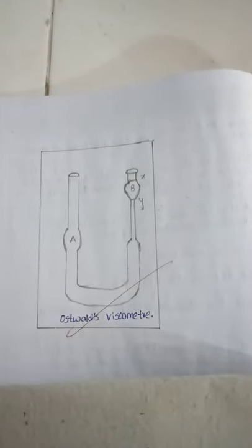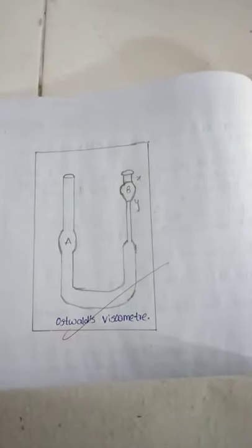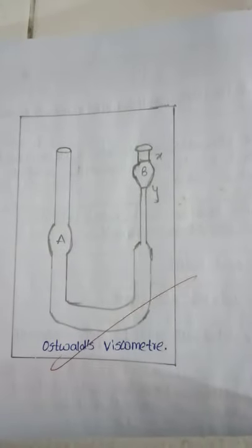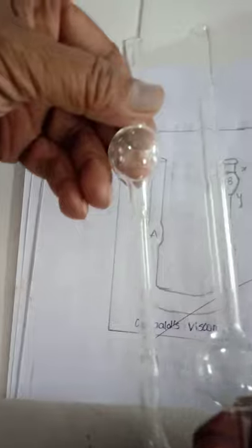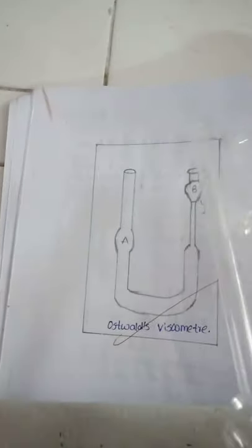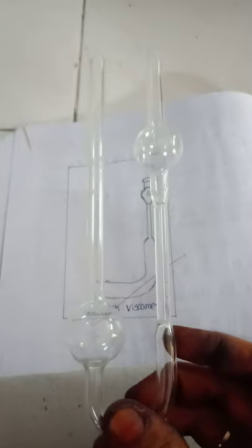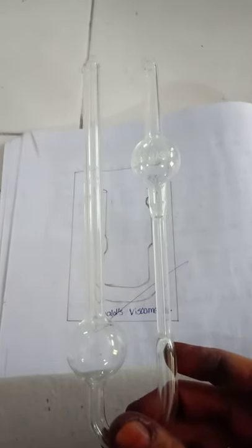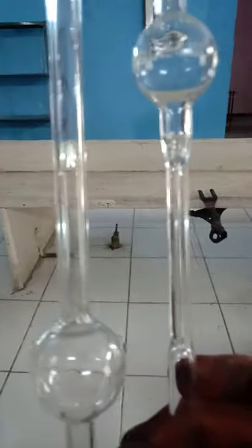Our next experiment is determination of viscosity of a given liquid using an Ostwald viscometer. This is our Ostwald viscometer. It consists of two bulbs, bulb A and bulb B. Bulb B consists of a capillary tube, while bulb A consists of a normal tube.